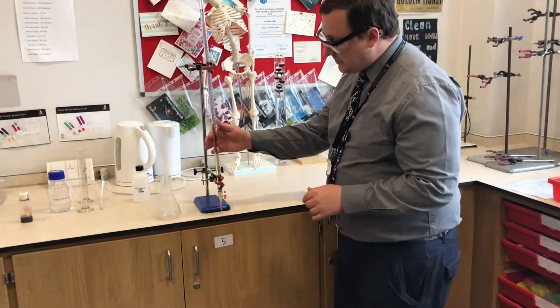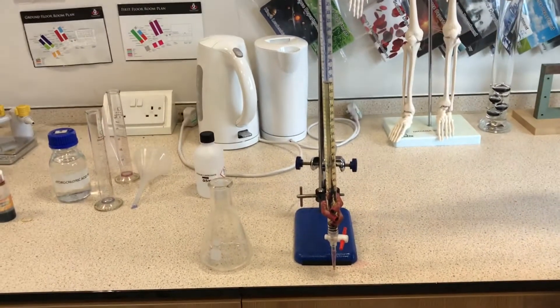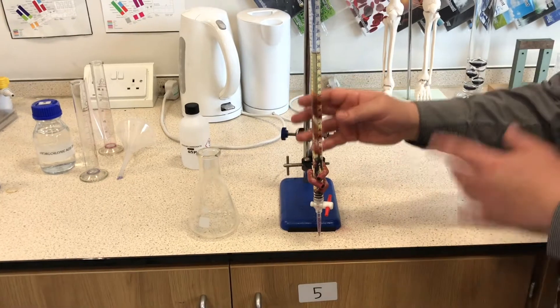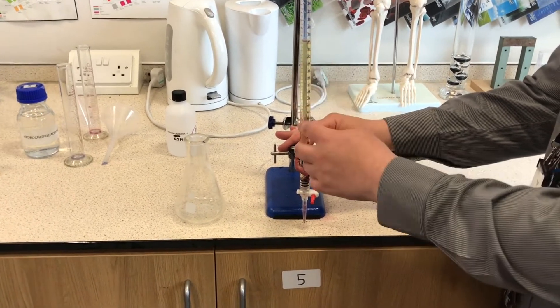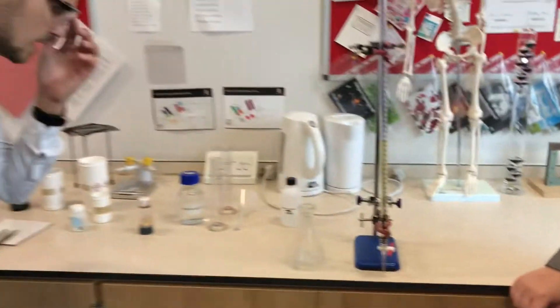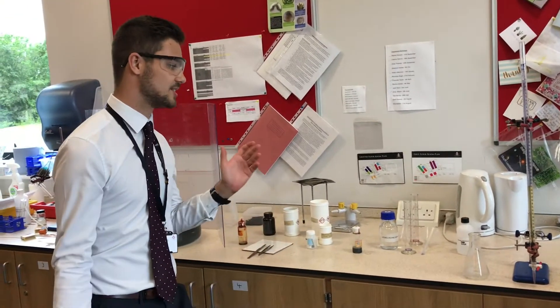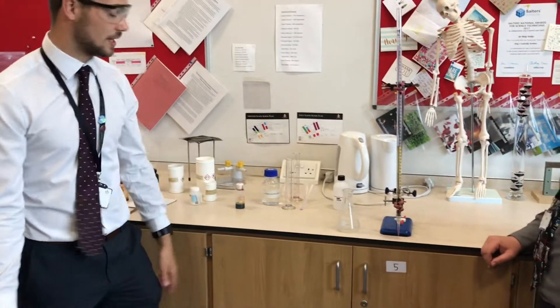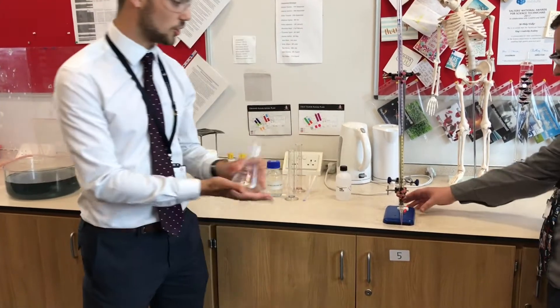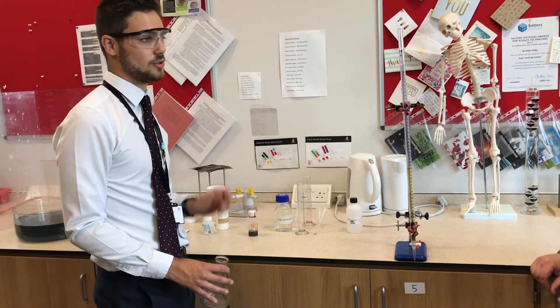We are back again. We left it a few minutes and all that's happened is it's completely finished reacting. We've lost all the CO2 that's going to be released, and we've got a final solution that didn't actually end up turning out to be green — it's a little bit more orangey-yellow. Back to Mr. Rees to tell us about that. Clearly our calculations were slightly off, so what we're going to do now is take it away from the burette and move to the conical flask, just so we can turn this weak acid into that neutral solution we were looking for.